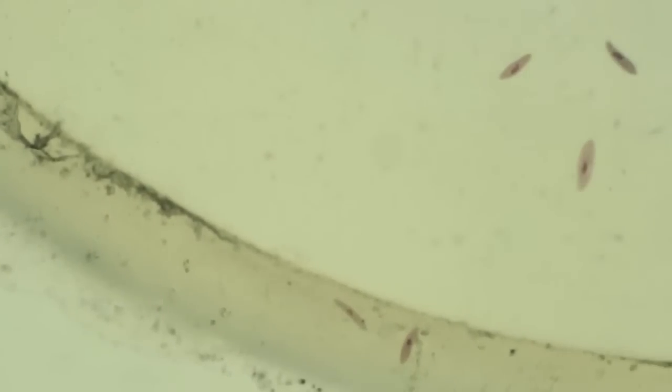And as you can see from the edge of the cover slip, we're getting very close to the bottom edge of this particular specimen. And down and over again. All right, one last pass and we'll have mapped the entire slide. There you can see actually a couple of paramecium that are outside the cover slip in the embedding media coming out of the bottom of the cover slip.